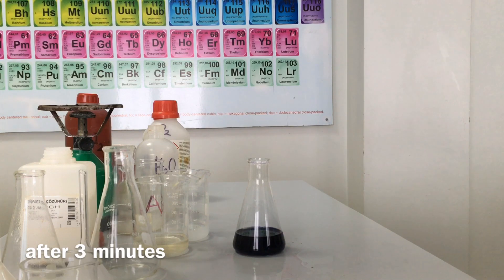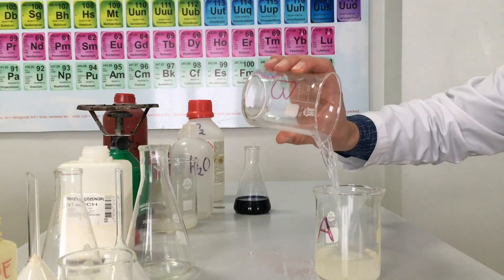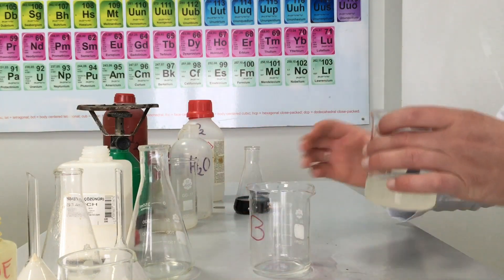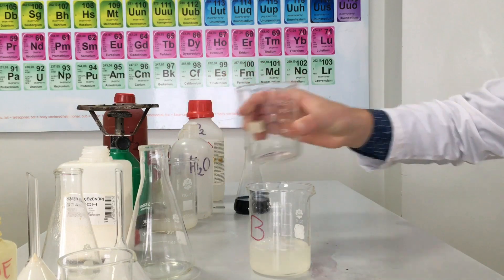The blue dark color shows the presence of starch and the iodine.